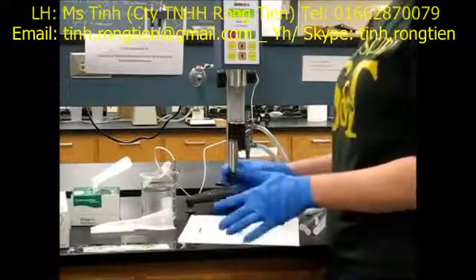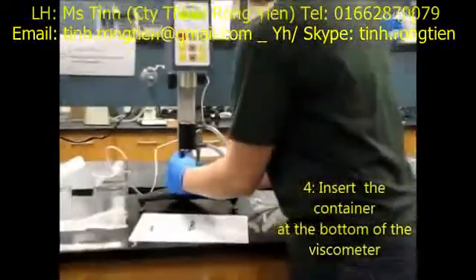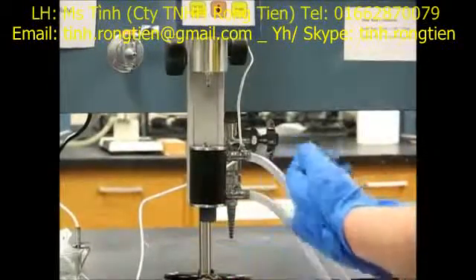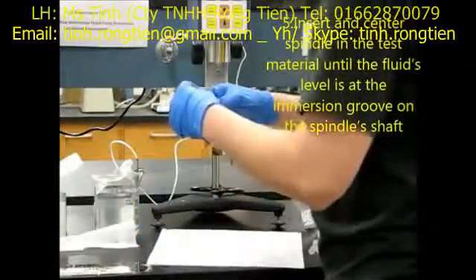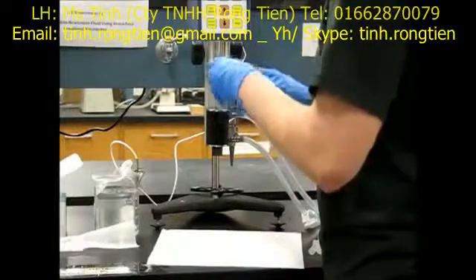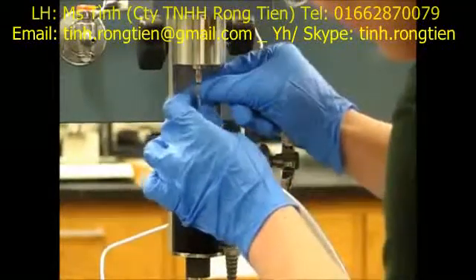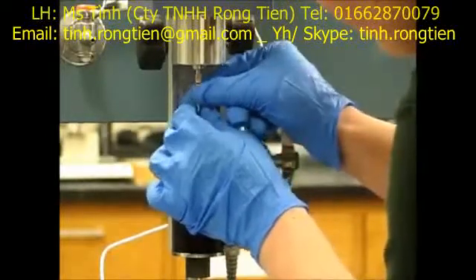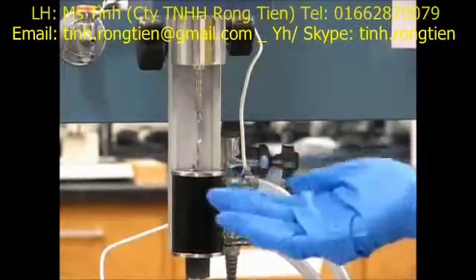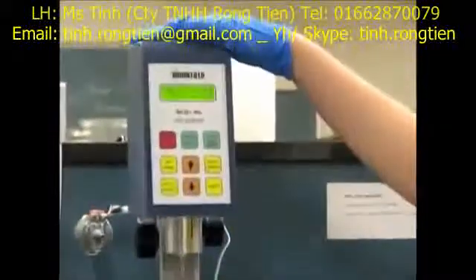Now that our sample container is around 25 percent full, we're going to attach it. There's a little groove which you want to match up with the inside of this container, so place it below, push it up until the grooves match together, and then lock it in place. Then we're going to take our spindle and slowly place it in the sample container, attaching it to the viscometer and tightening it in a clockwise motion. Make sure that your spindle is fully submerged in the polymer solution before continuing, then press any key.